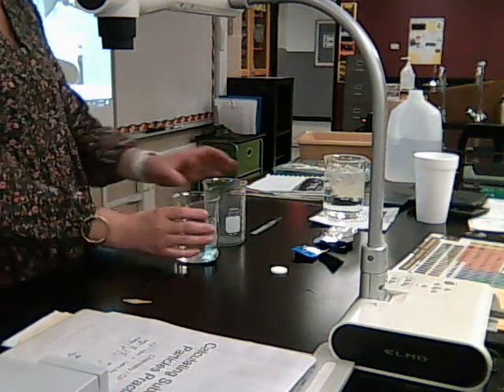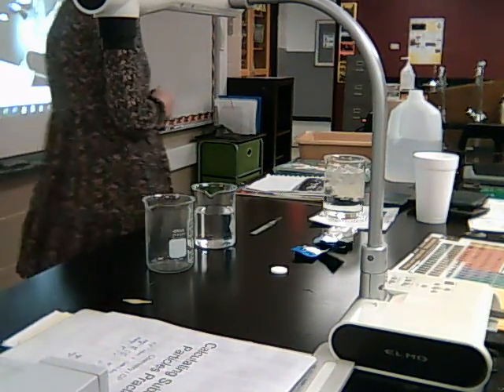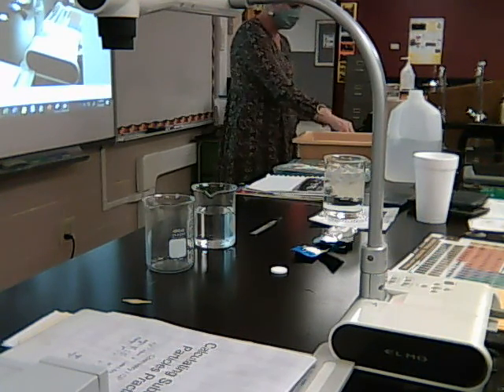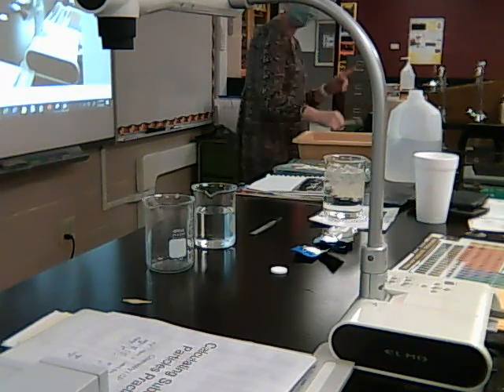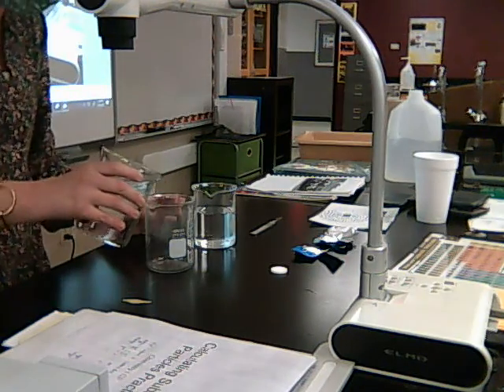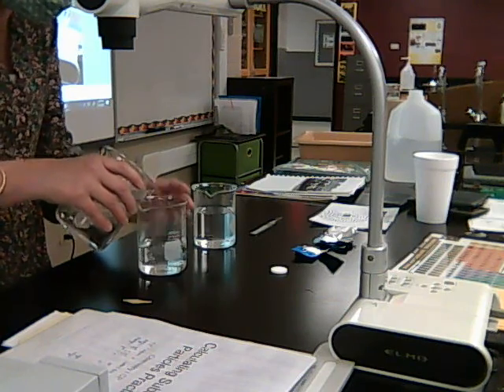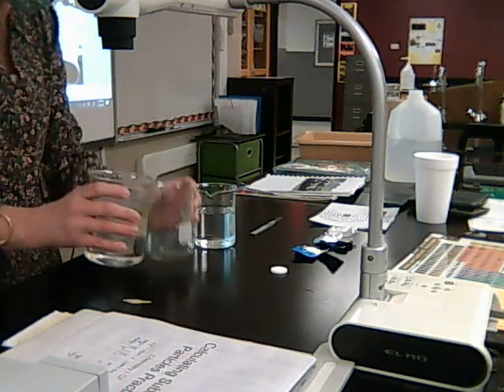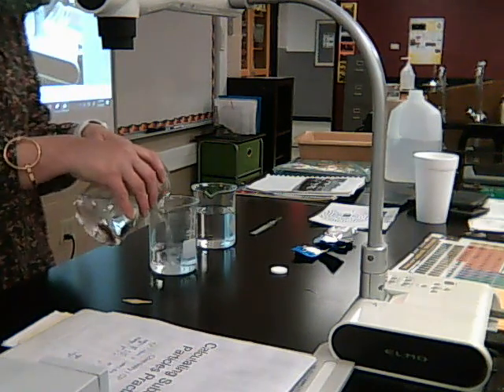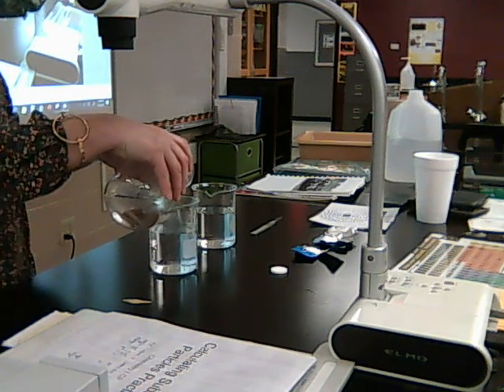And I'm going to use the same amount of water. I'm using 250 for the room temperature. I'm going to use 250 mils for the cold, and 250 mils for the hot, which looks like it's getting pretty hot now. So I'll take that one off in a minute. I'm going to do the 250 in the cold first. I'm going to get them ready. I'm going to try not to get any ice in it, but it's not working too good. Let me try it again. I just want the water. I don't want the ice because I'm afraid the ice could affect it. The other beakers don't have ice, so I don't want ice in this one either.